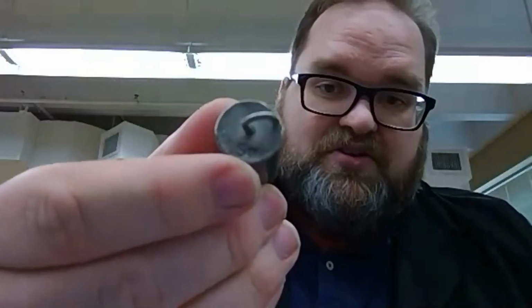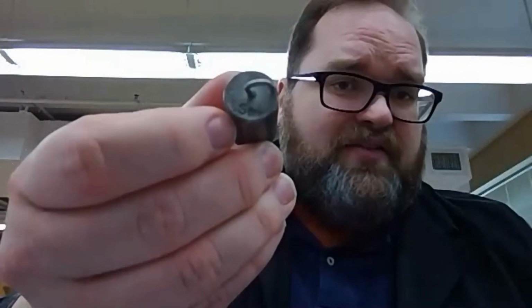Now, first thing we always do when we get an unknown is look for any identifying features. And you can see there that one says Sn. So we already know that Sn is the identity of our metal, so be sure to record that. But there's more stuff that we need.